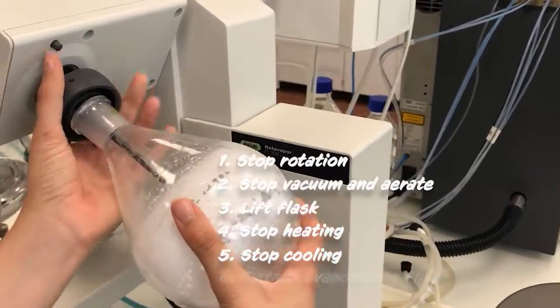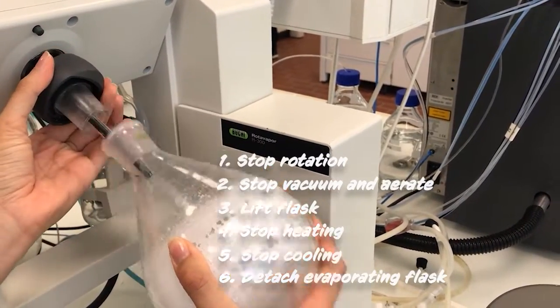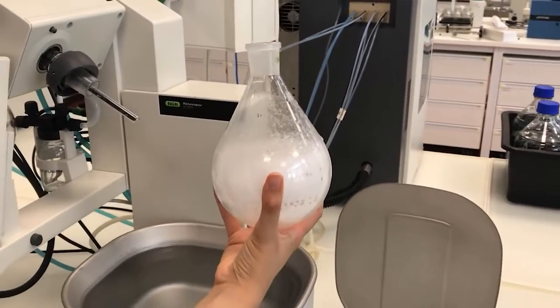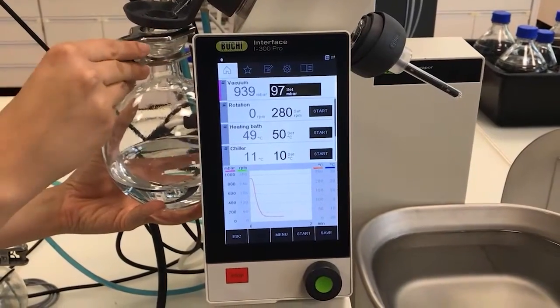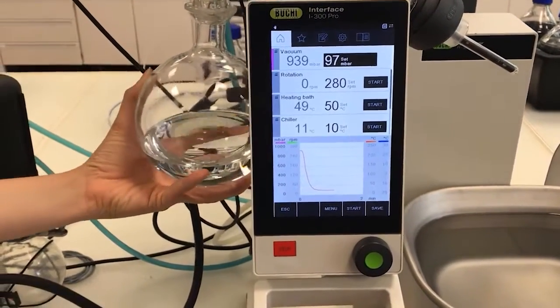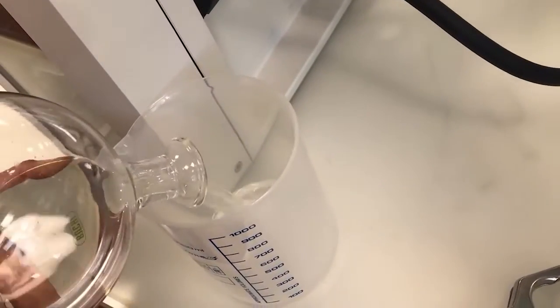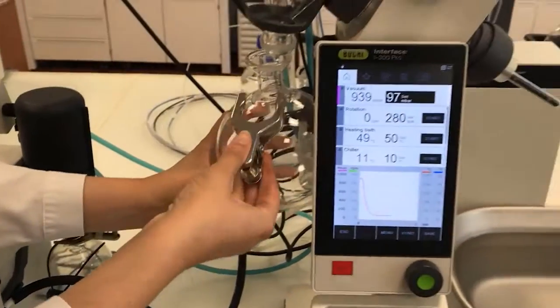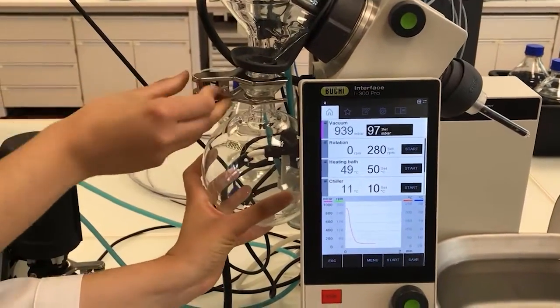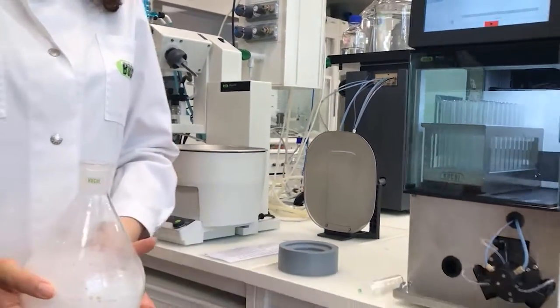I can now detach my flask. Then we empty the receiving flask in order to make sure that our rotovapor will be ready for our next use. Our dry sample is now ready for further processing.